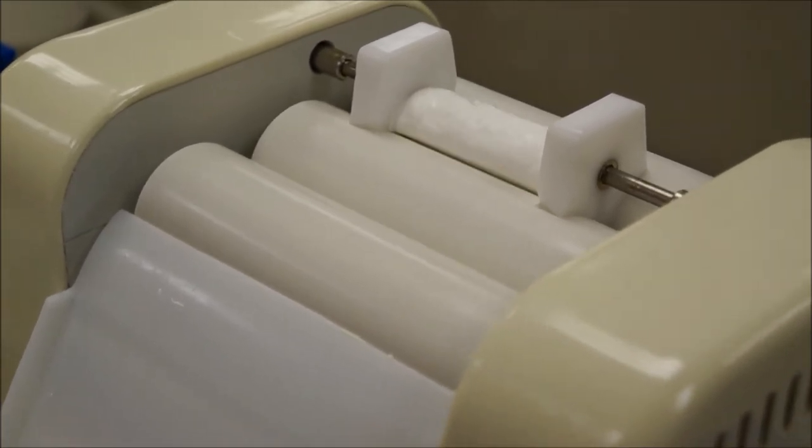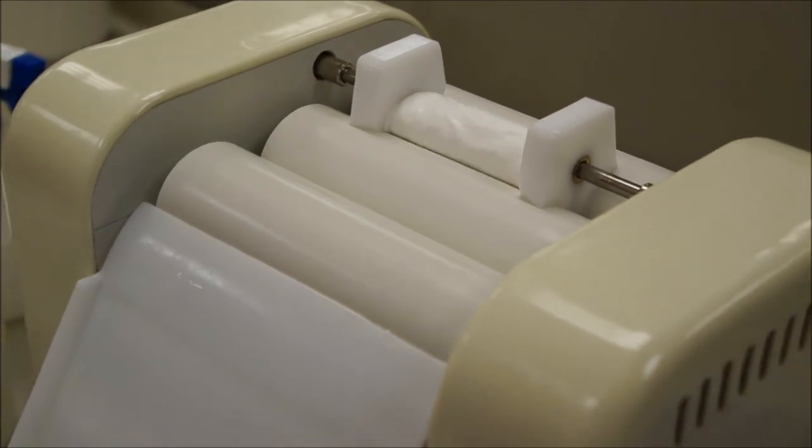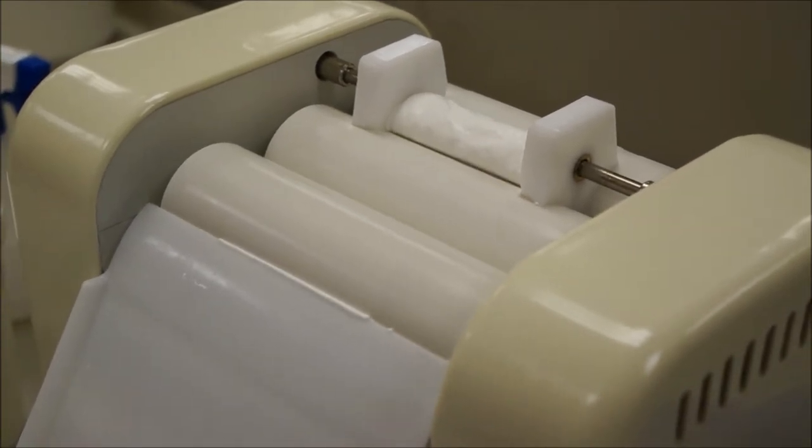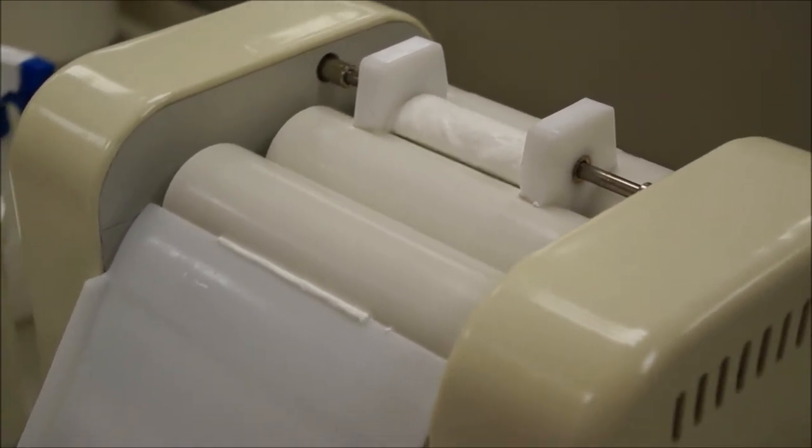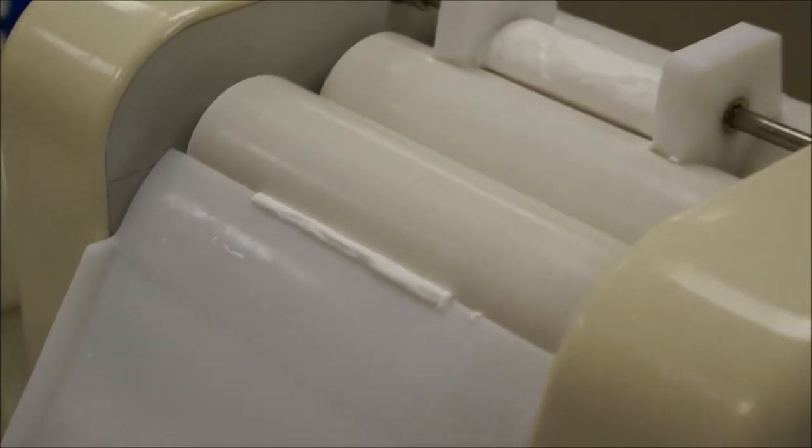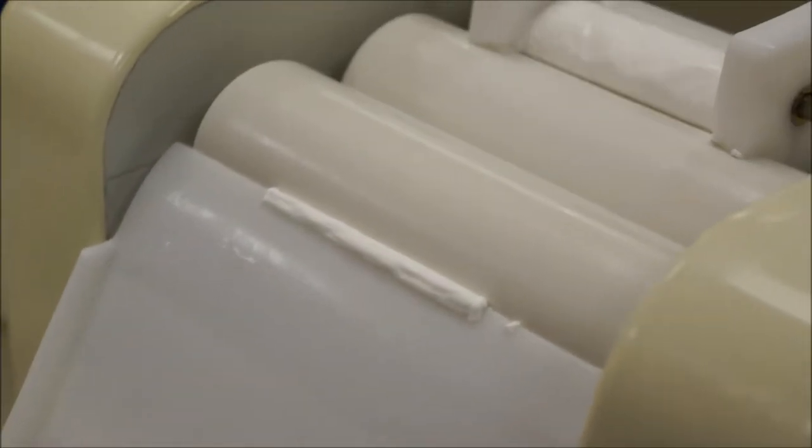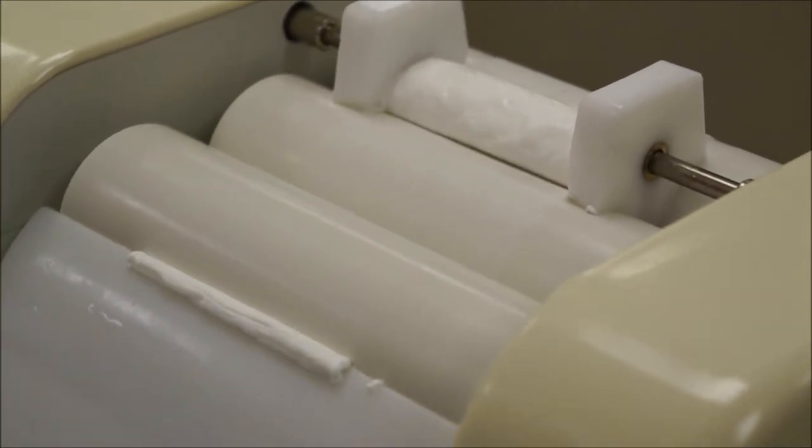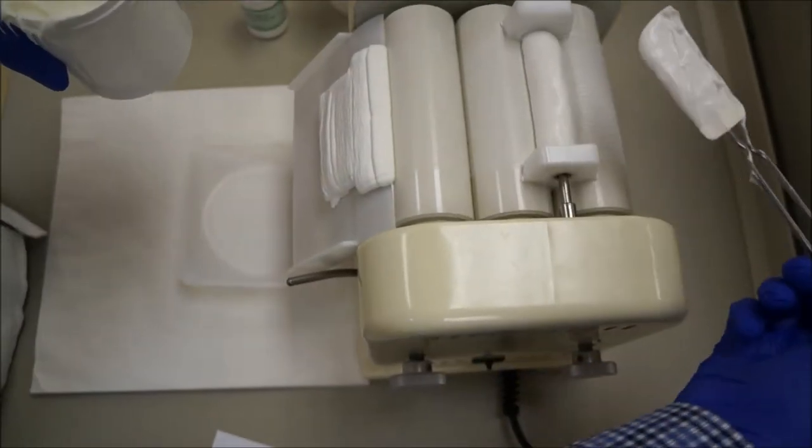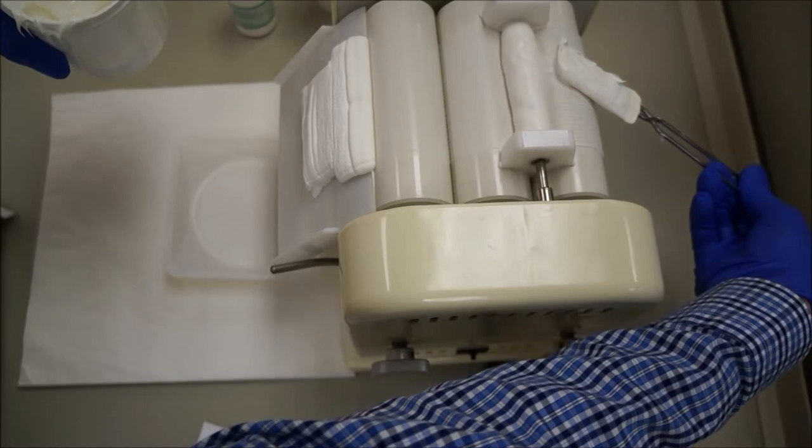Make sure you have something to catch it if it falls off, or if it's a pretty thin ointment or lotion. As you can see, it's forming here now. It takes a little bit of time to run depending on how you set the knobs and when you add it.